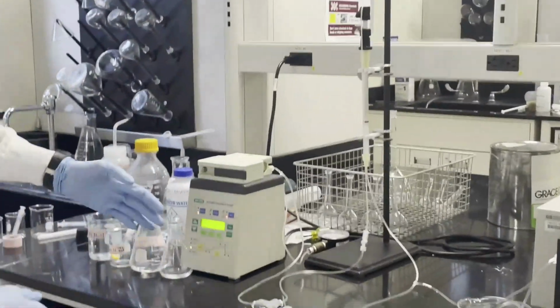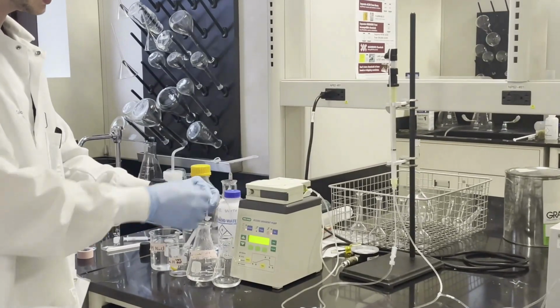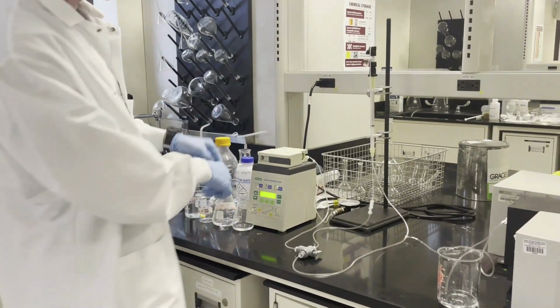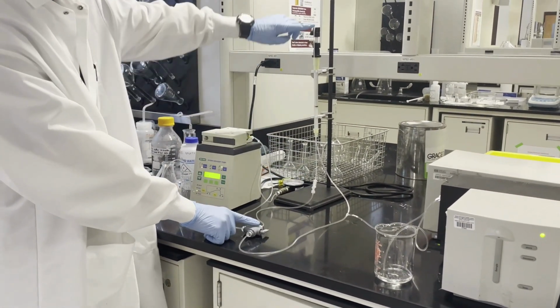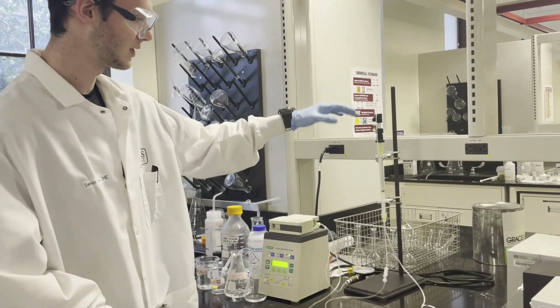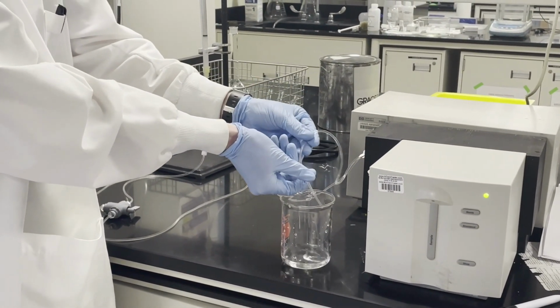So the way this works is we run RO water through the column first to help remove any impurities. Next, we switch this pump into our loading buffer, which is a basic solution. And then we turn the pump on, and it flows through this pump, down through this valve, and all the way up into the column itself. So this is going to take a little bit of time for the loading buffer to go all the way through the system, but eventually we will see it exiting the system through this little tube here. And so you can see we're pushing little droplets out, so we know that there is flow through the system.